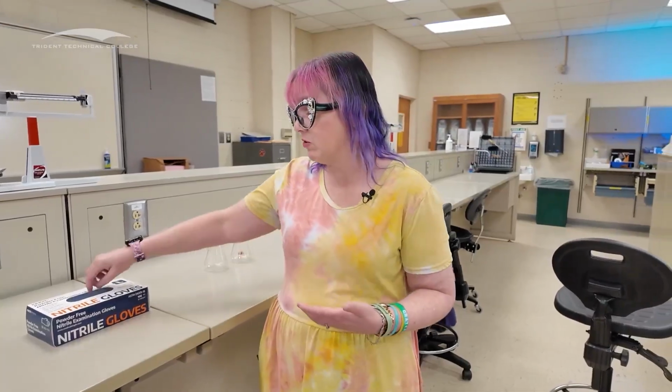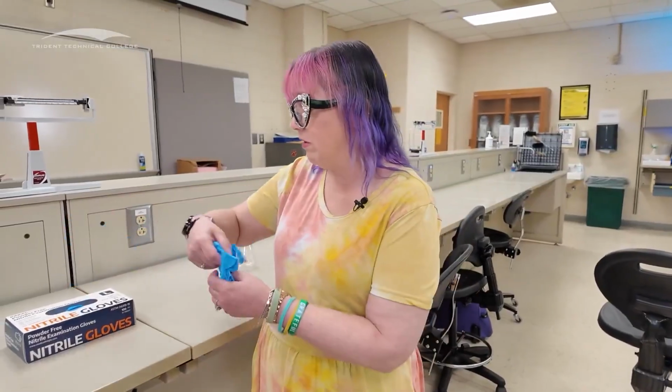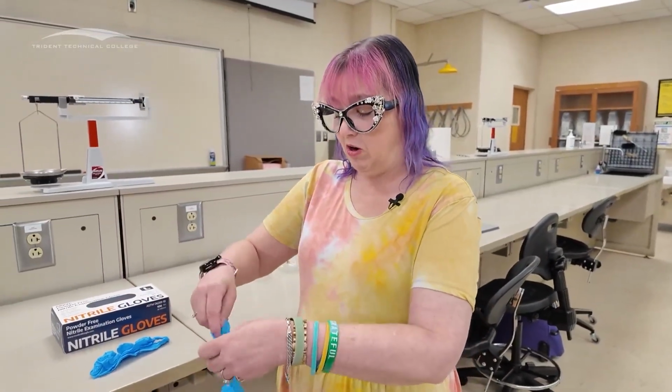For these, it's necessary. So I want to show you how to properly put on a pair of gloves, how to take them off, and then talk about what are proper protocols for using those gloves in those experiments. So let's talk about how we put those gloves on. So we're going to take gloves out of this container. Here's 1, here's 2. I'm going to set those down. We're going to make sure that we put them on appropriately.